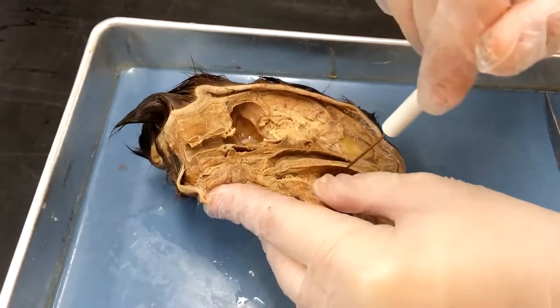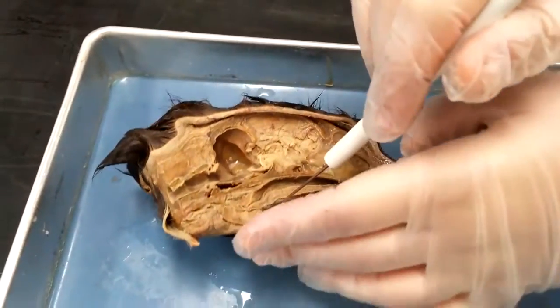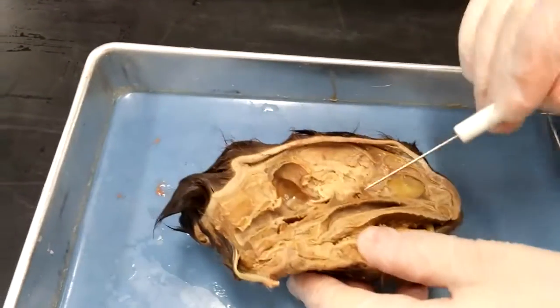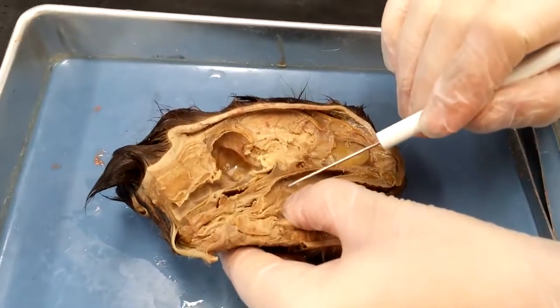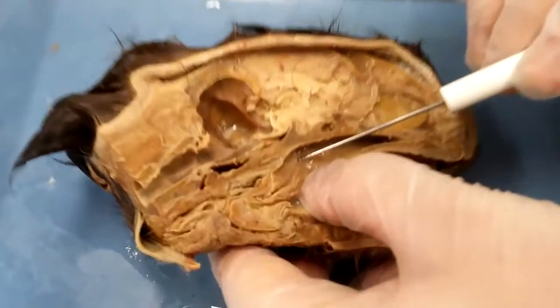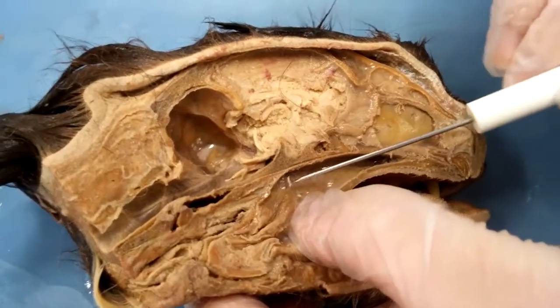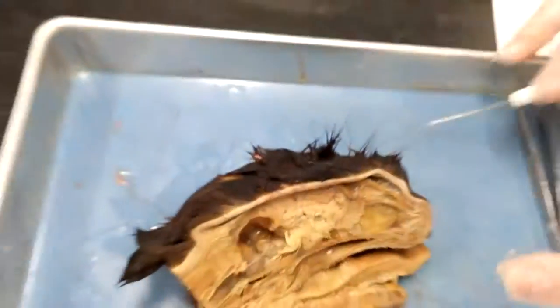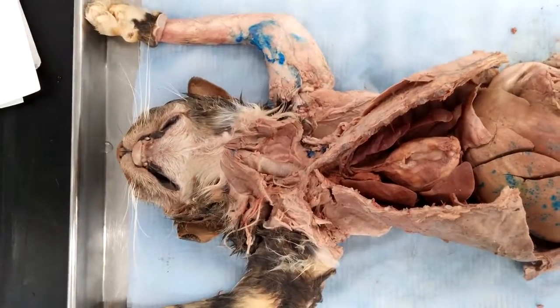It becomes from hard to soft. And then we have the ostium of the auditory tube, so it's right here. That hole right there — do you see that in the video? That's it.